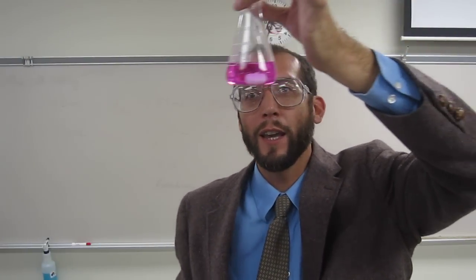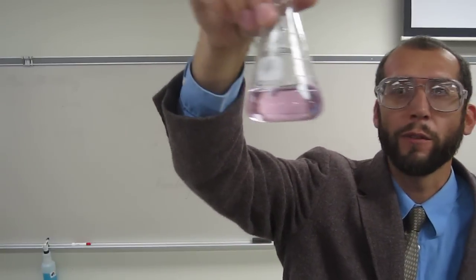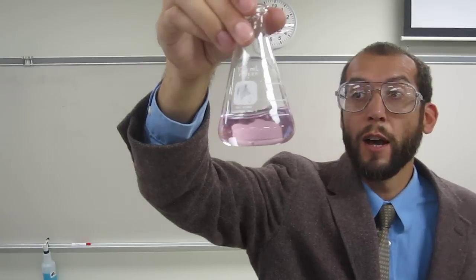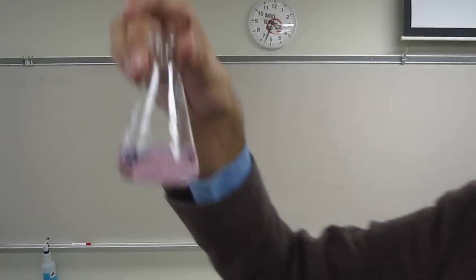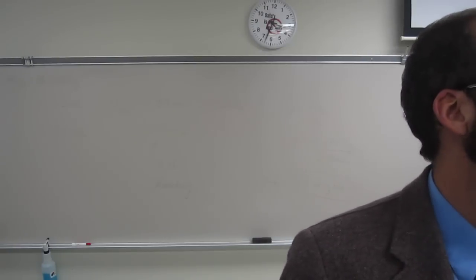So again, not this dark, dark fuchsia, but barely turned over. In fact, this was clear right before this, right? And then this is one drop in back in. Okay, so pink. We messed up on the first trial, that's why we have other trials. Yeah, exactly. Well, you get better. You're gonna get better. Okay, any questions on the color you're supposed to be looking for? Okay, cool.